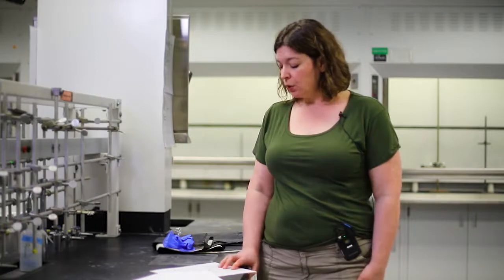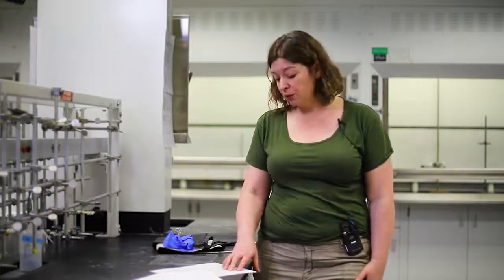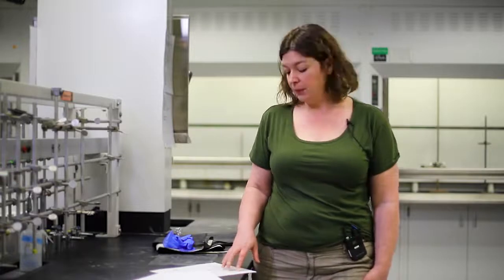We've told you about all of these horrible hazards. Now, how are you going to protect yourself? You're going to follow the safety rules whenever you're in lab or whenever you're doing a science activity. These rules have been developed to minimize your personal risk from laboratory activities. You're going to wear safety glasses or goggles, and we'll show you what those look like in just a couple minutes.